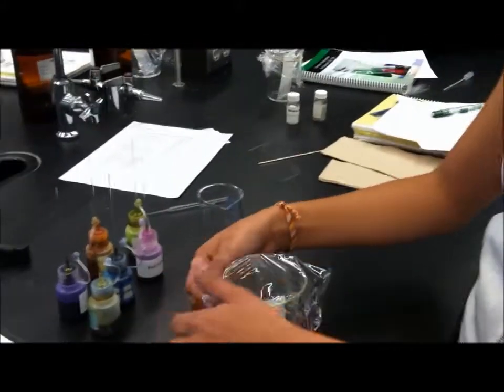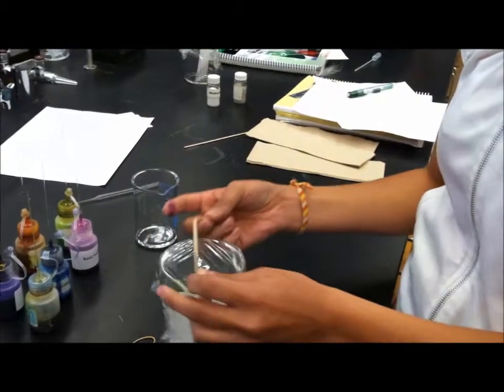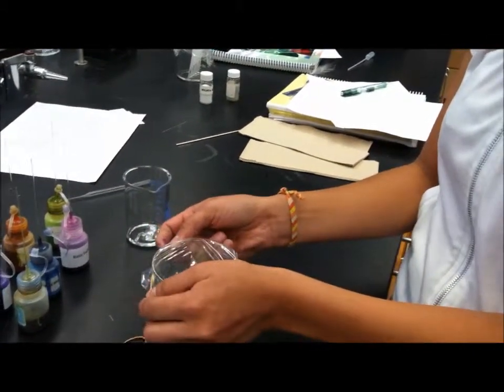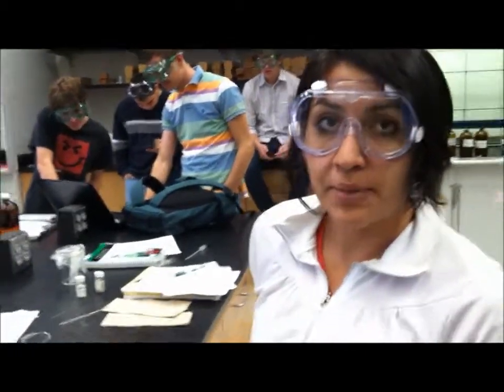We're doing so quick, we'll just wrap Saran wrap around on top of the beaker. We'll put our rubber band around it. After doing so, we'll wait to see how far up the spots go on the paper plate.